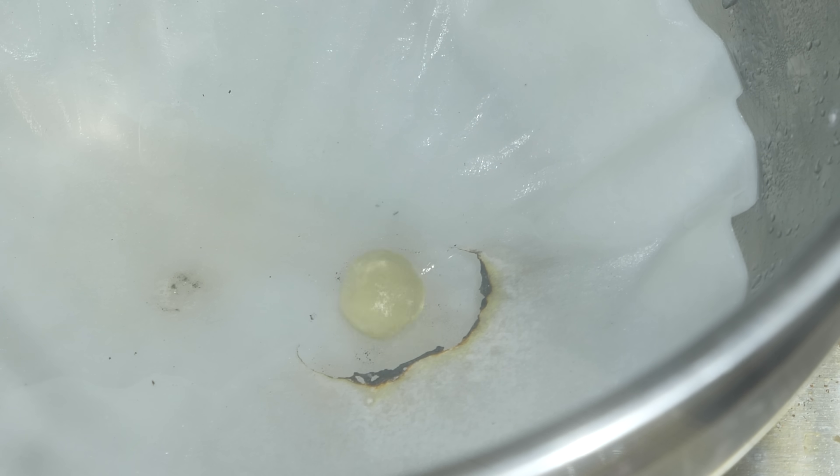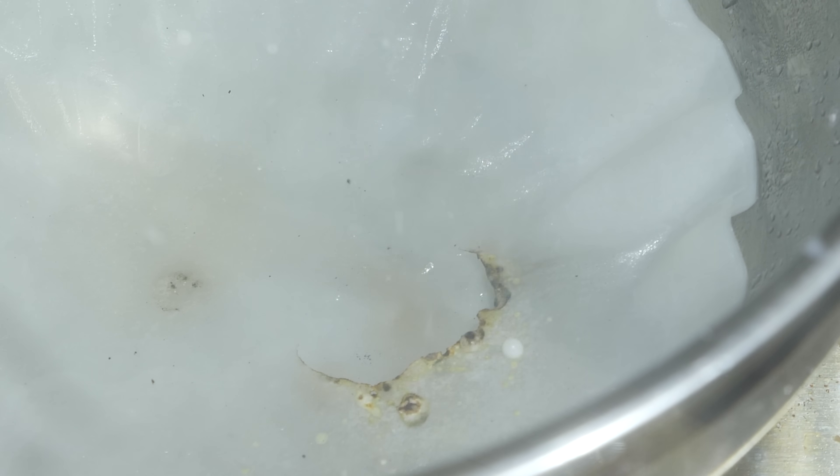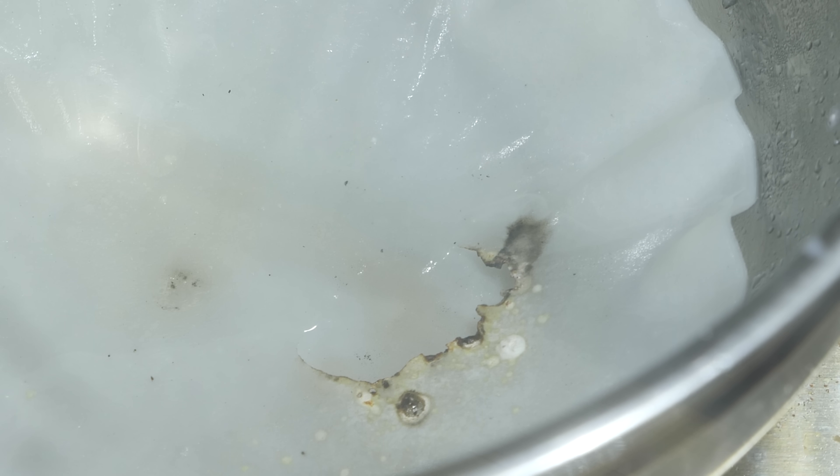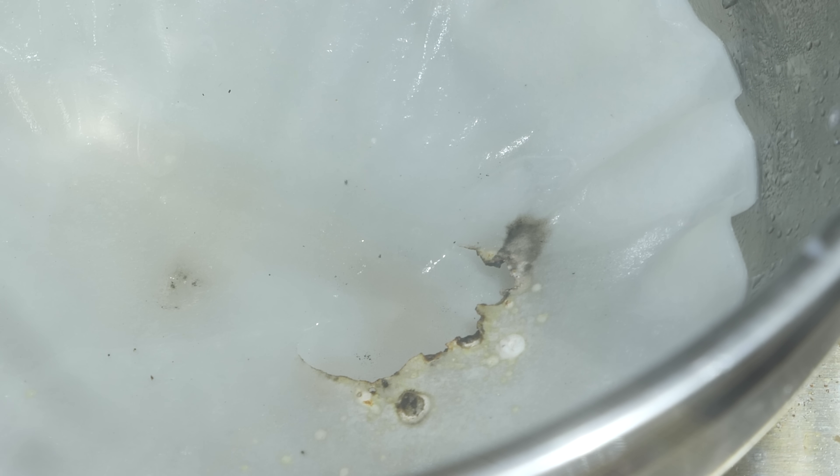It's completely clear now. Look at that. Whoa. So we actually end up with a crystal clear drop here that suddenly explodes at the end.